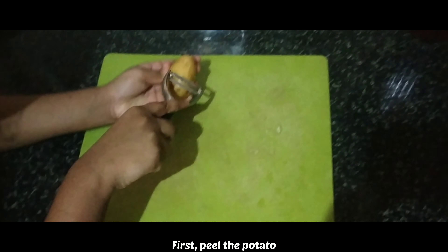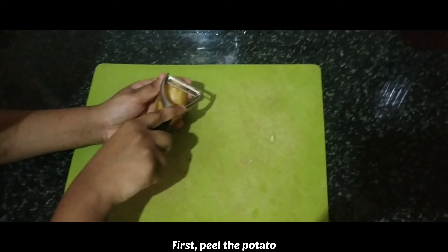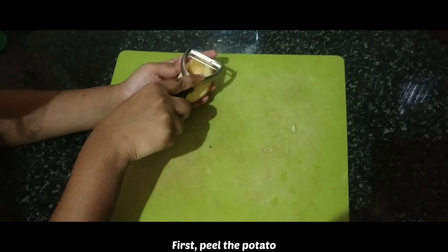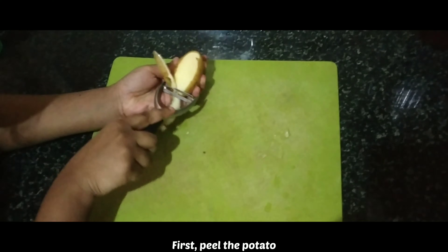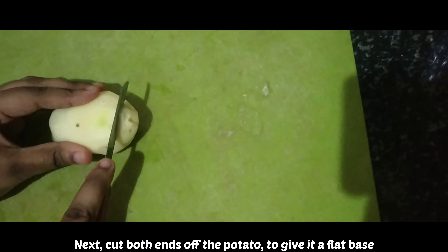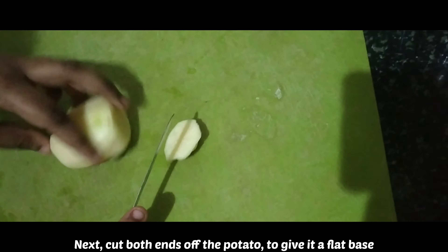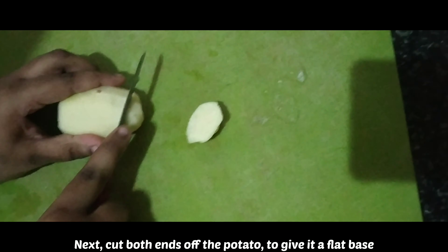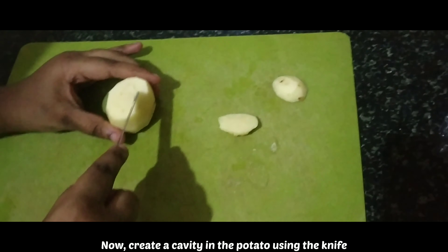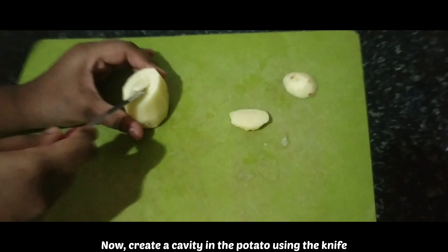First, peel the potato. Next, cut both ends of the potato to give it a flat base. Now, create a cavity in the potato using the knife.